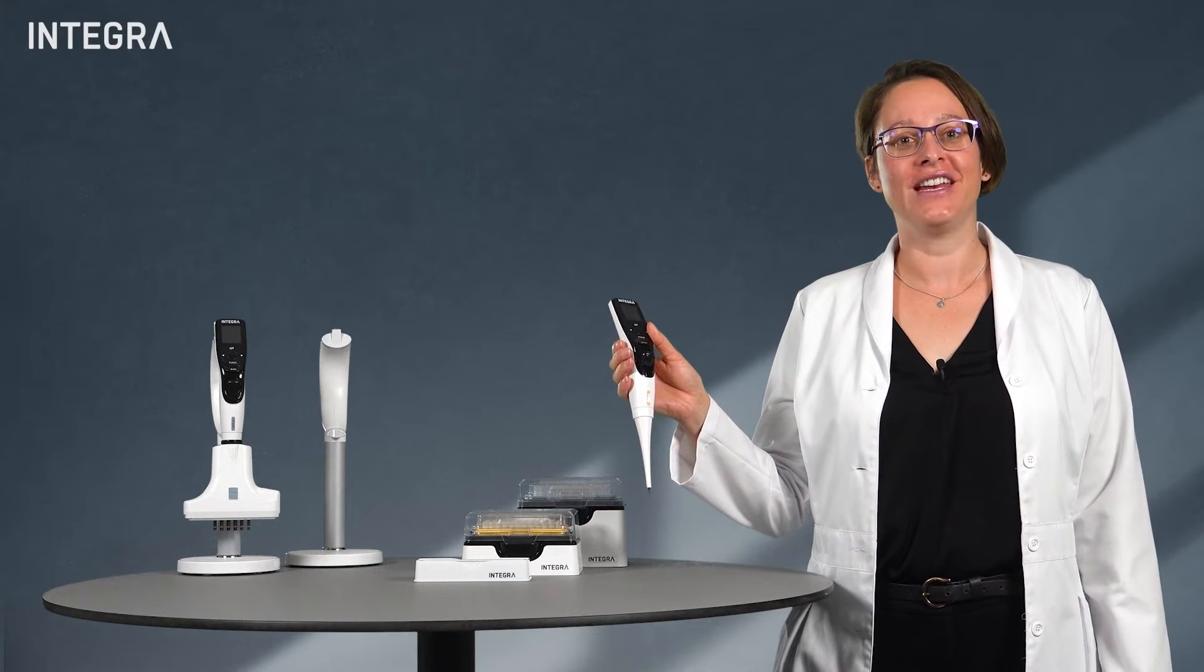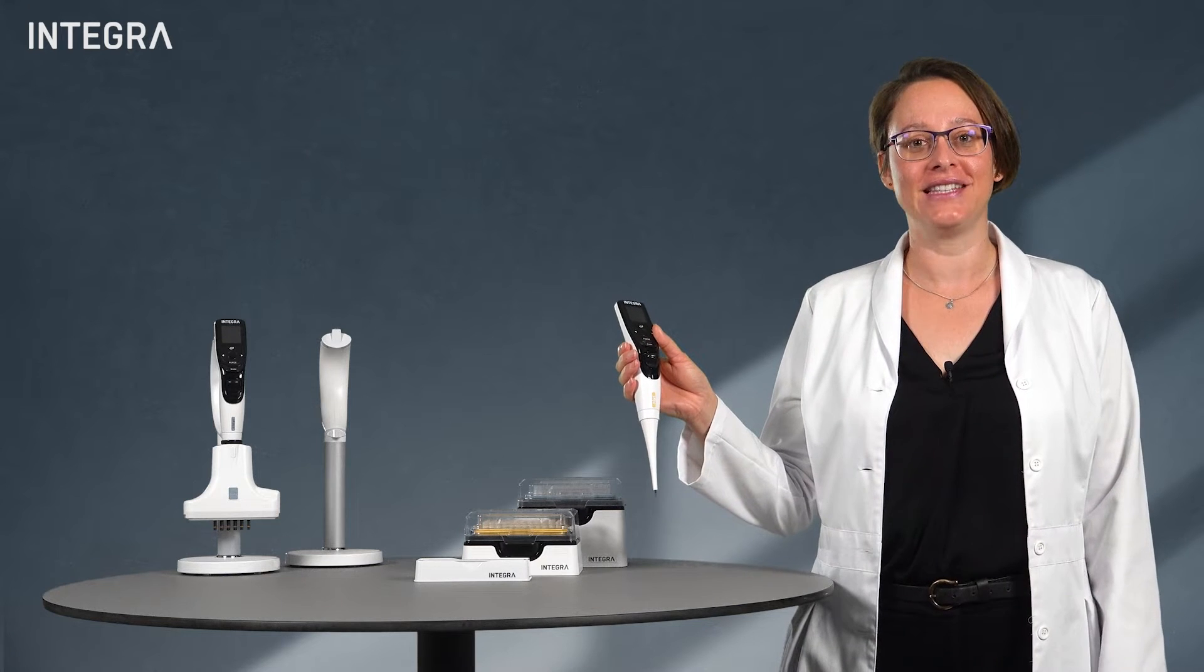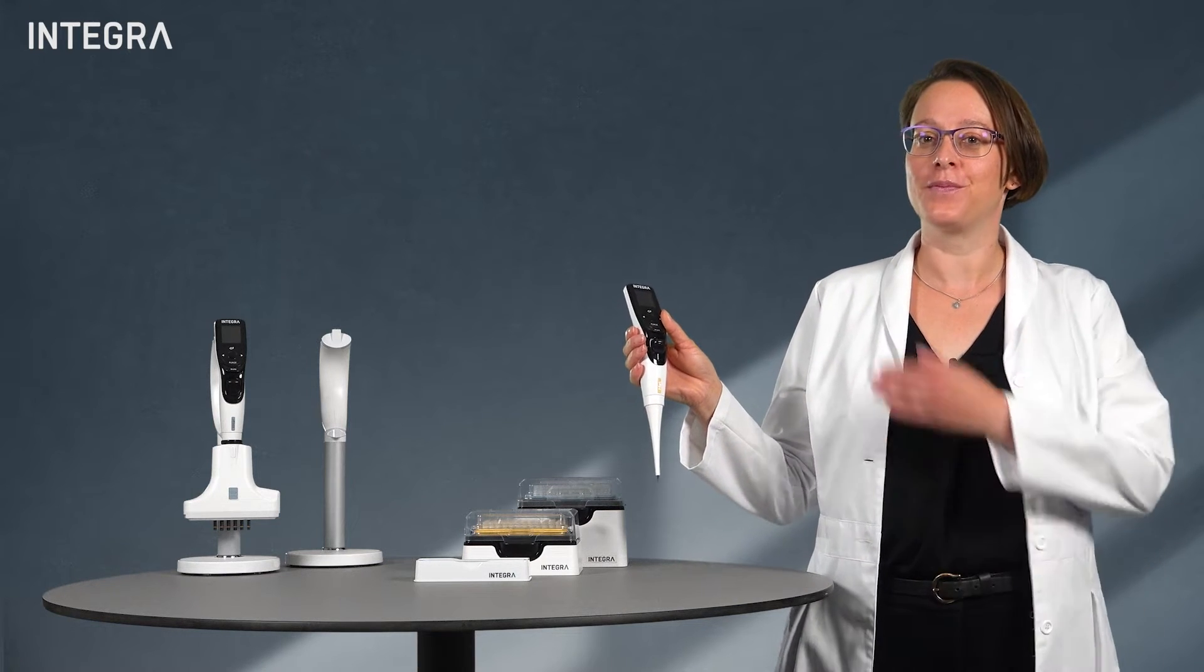Hello! So now you've finished pipetting and you're ready to do something else. Remember, your pipette is a precision instrument.